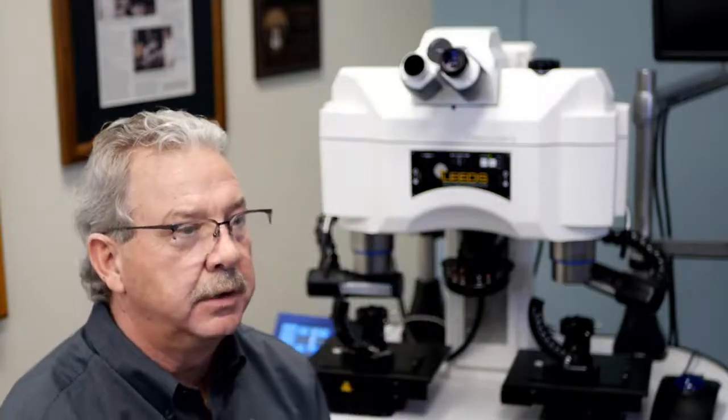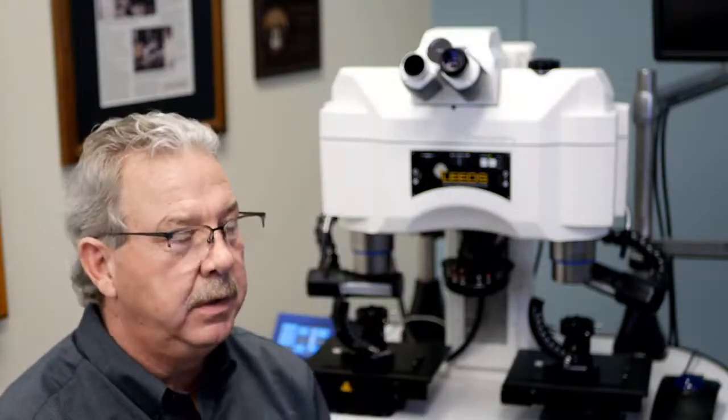Here's actually a 22mm field of view eyepiece. WHN is a series of abbreviations: wide field, 10x. The H is actually standing for, I believe at this point, a focusing eyepiece, and then finally the 22mm field of view. You'll also see in this case a little pair of glasses there.